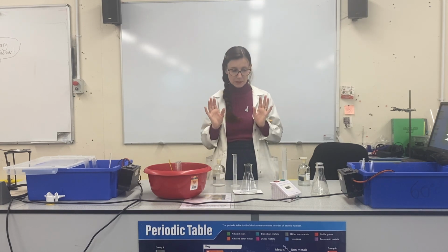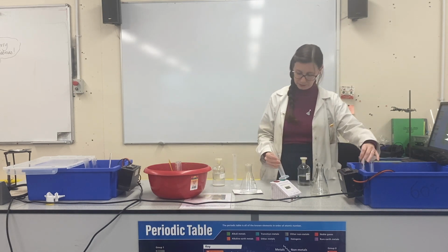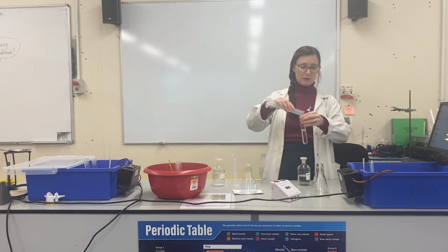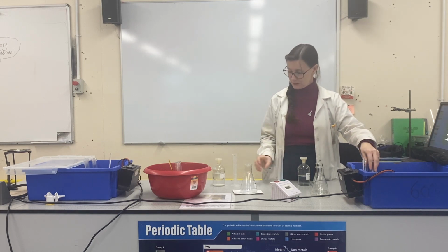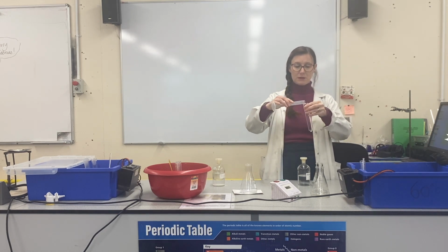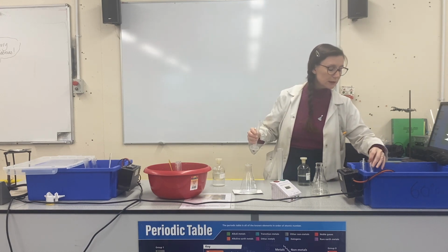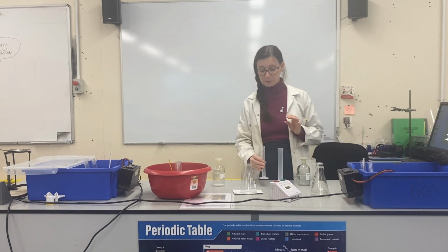Okay, so let's get started. I'm going to put my acid in there, and leave it to stand, and my sodium thiosulfate in there. It's just me doing the experiment today, so that's not a problem.